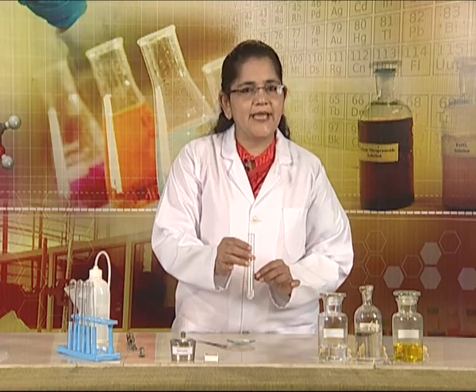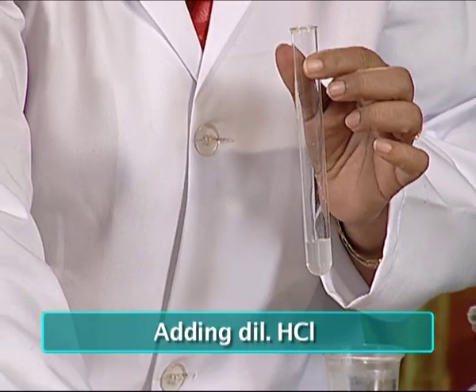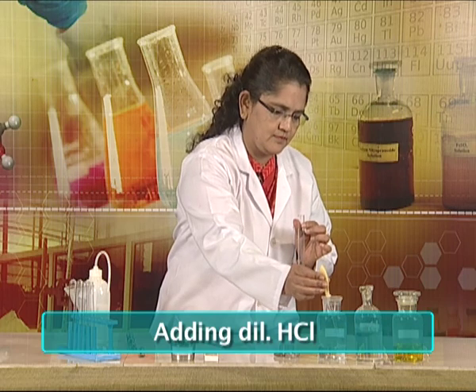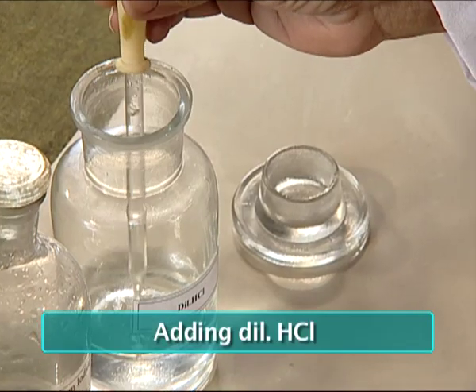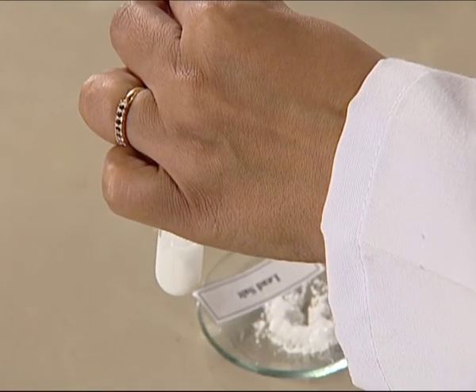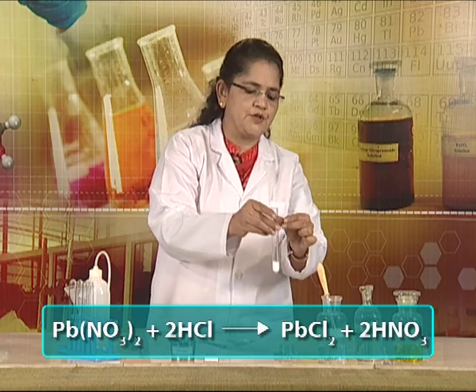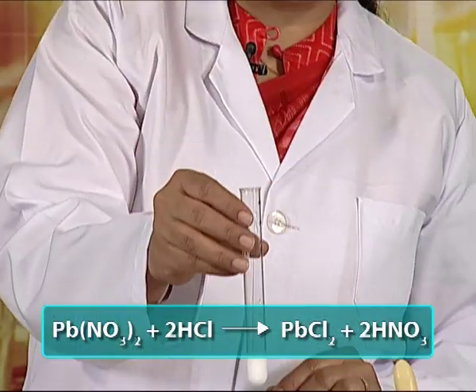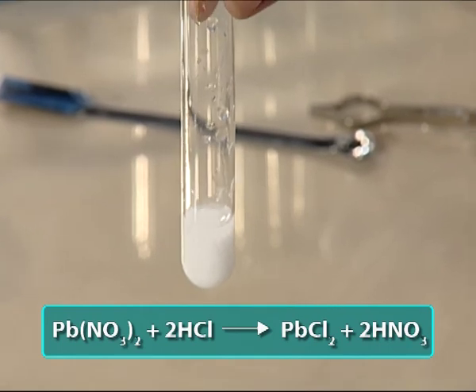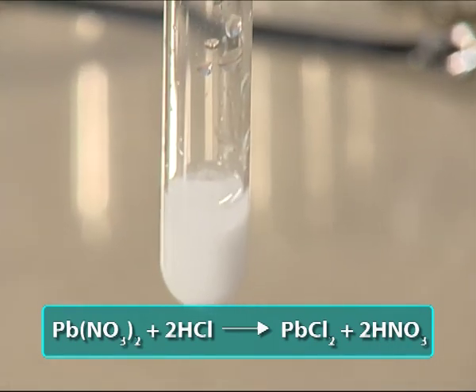Now, we add dilute HCl to the solution. Observe what is happening. The formation of a white precipitate indicates the formation of lead chloride and indicates the presence of lead ion.